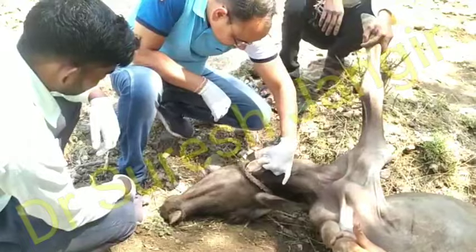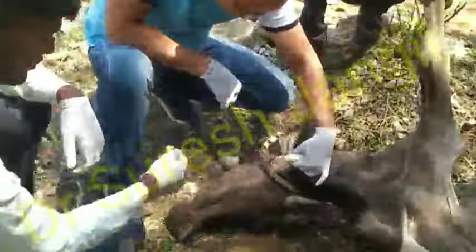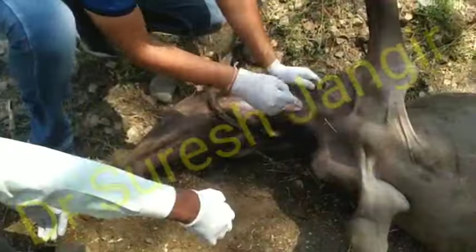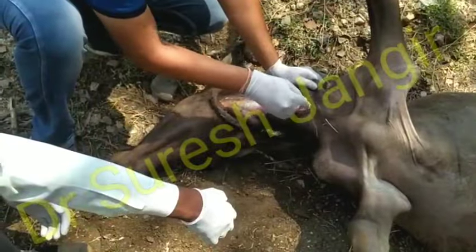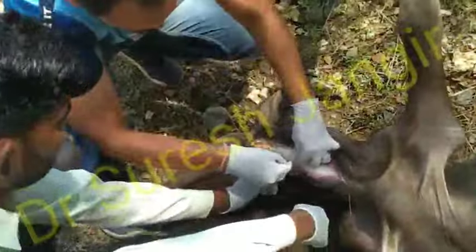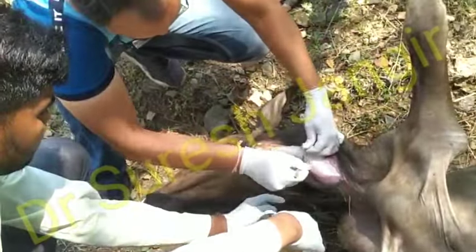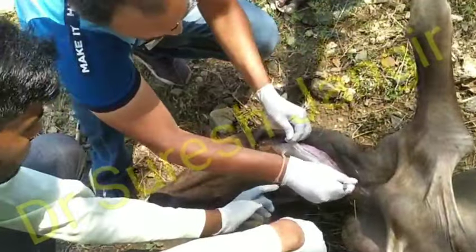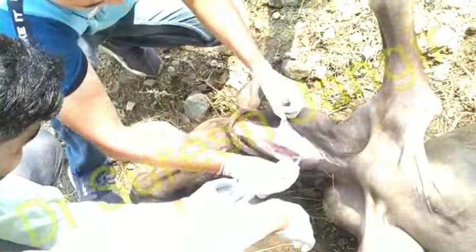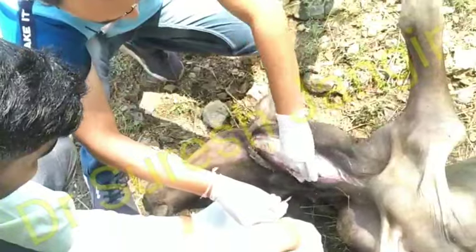After the external examination, we should go for internal examination. For internal examination, we start an incision from the point of the chin to the ventral aspect of the body. On opening, we found that the trachea is collapsed and tracheal rings are broken, due to the bite of a wild animal at the neck region, and the windpipe is collapsed.